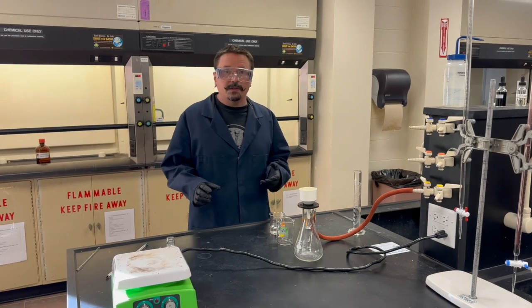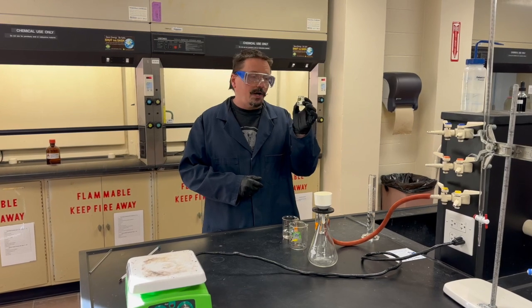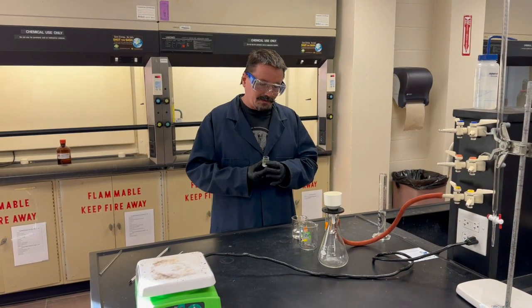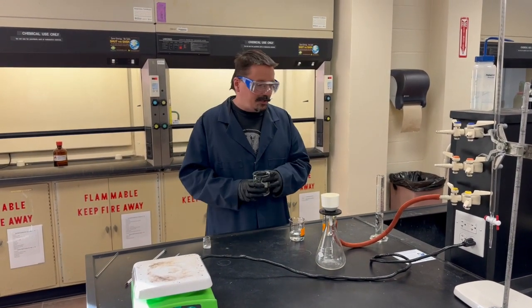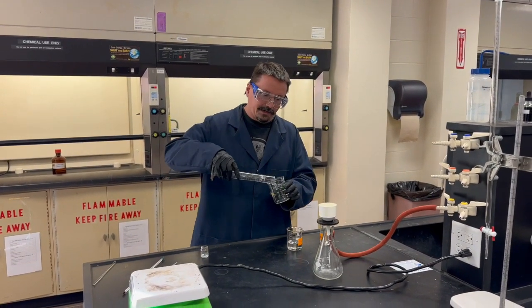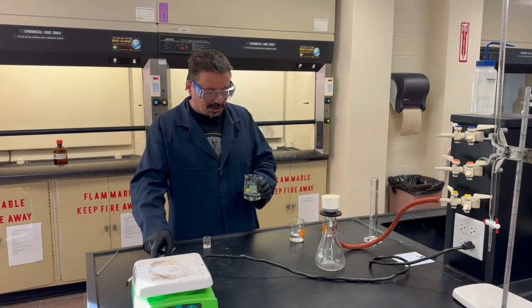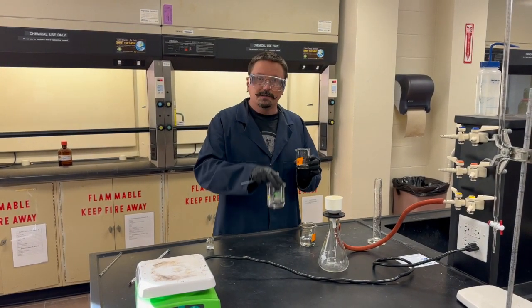Today we're going to cover the gravimetric analysis of an unknown sulfate. You'll get your unknown powder in your unknown jar — it's some kind of metal sulfate, but we don't know what the metal is, so we don't know the gravimetric factor. Mass out the appropriate amount, add it to your 250 or 400 milliliter beaker with approximately 50 milliliters of water. It'll be relatively soluble, but to aid dissolution we're going to make the water slightly acidic.